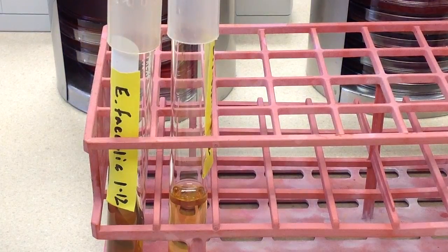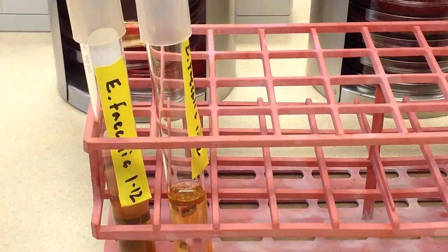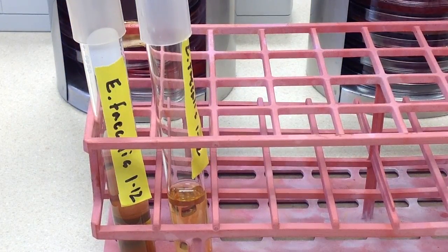Lastly, these tubes are going to be incubated in room air at 37 degrees for overnight, so basically for 18 to 24 hours.